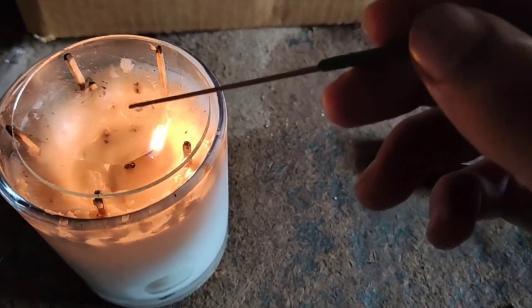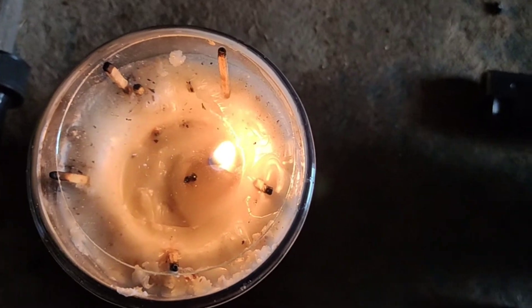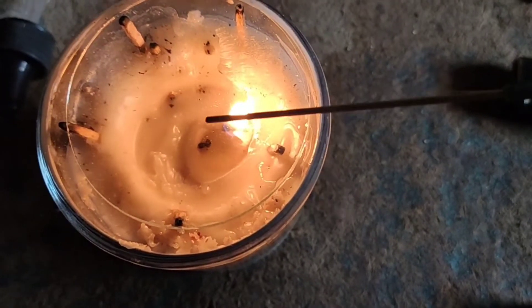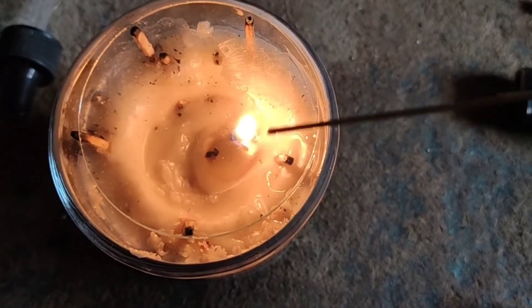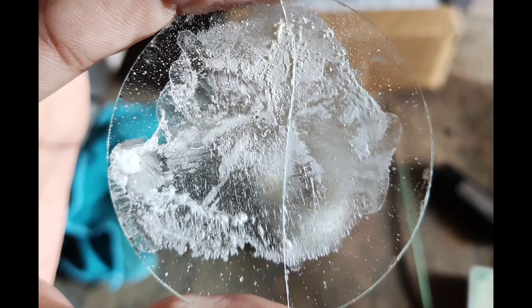In fast evaporation, if you evaporate water very quickly, there will be bumps between the caffeine crystals because water escapes between them, so the crystals won't look as good. You can also see the crystals forming here as the water evaporates. This is our final product from fast evaporation. We'll look at it under the microscope — the crystals are very beautiful compared to the first sublimation method. Look at this crystal web!